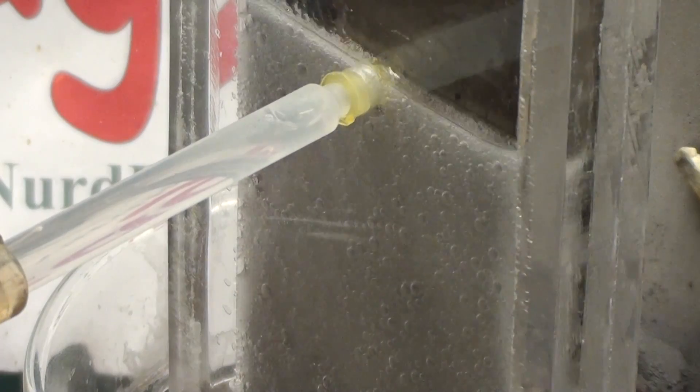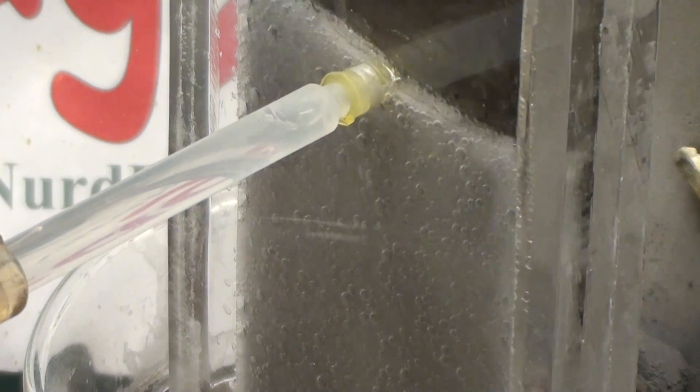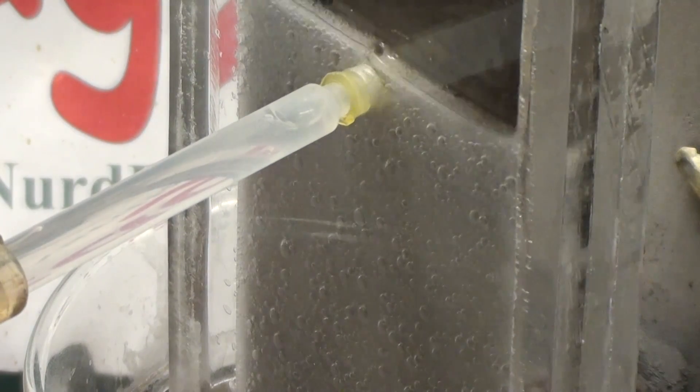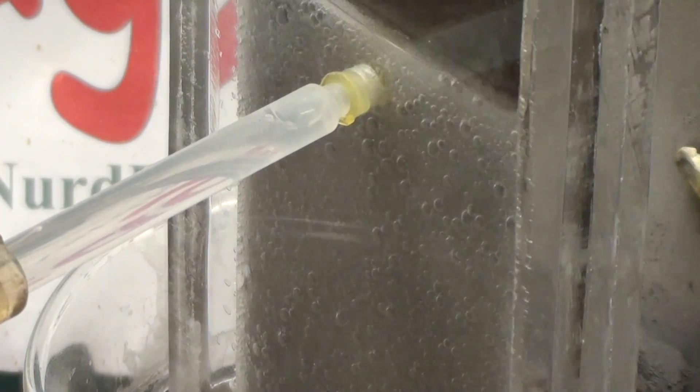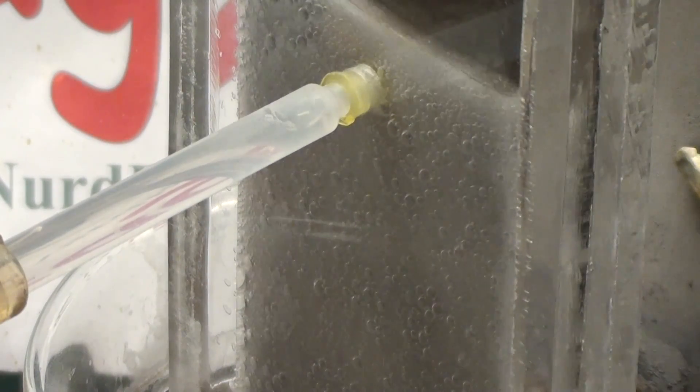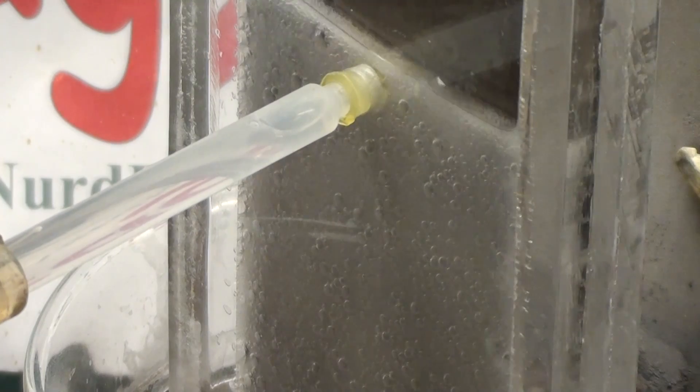In this case no electrolyte is used and the nafion itself is the electrolyte and the electrodes are coated directly onto the membrane. But fuel cells are a super complicated discussion for another time. For now we'll just focus on making sodium hydroxide.